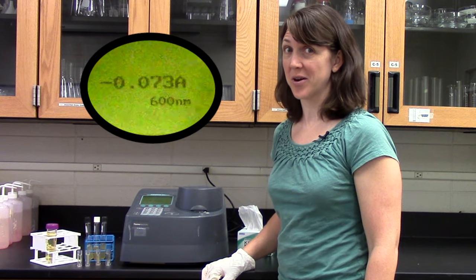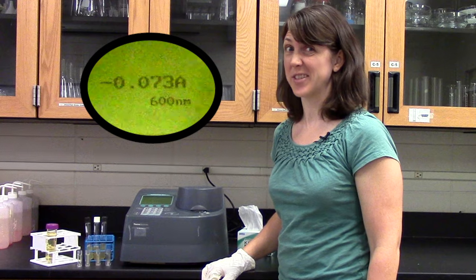Absorbance is never negative. If you get a negative number, something went wrong, so you should start over.